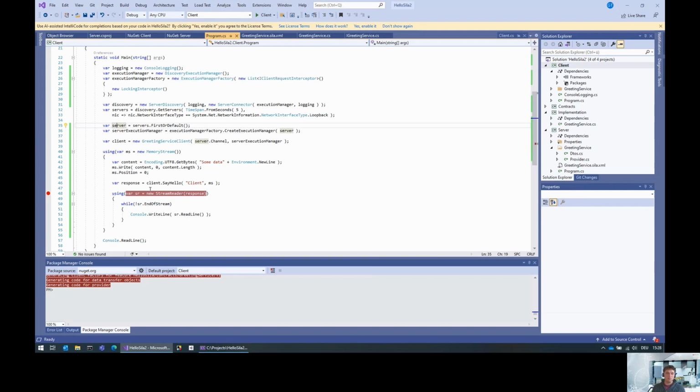But here we have something that uses metadata, and therefore we have to use an implementation that we pass into the client that actually has support for binary transfer, which the execution manager that we get from the execution manager factory has, because it knows exactly where to upload the binaries to. Because what's going to happen is that before we call this say hello command, we are uploading the contents of that memory stream to the server and then calling this say hello command. And that will give us a binary storage identifier, which the SDK then converts into the response here.